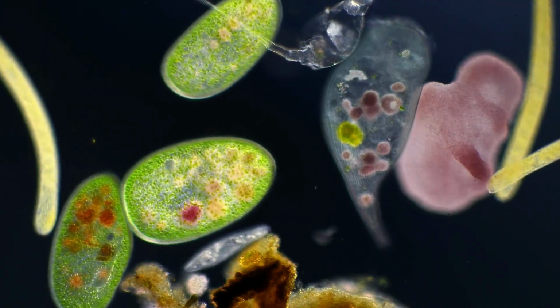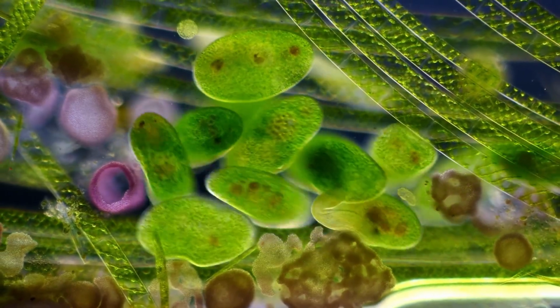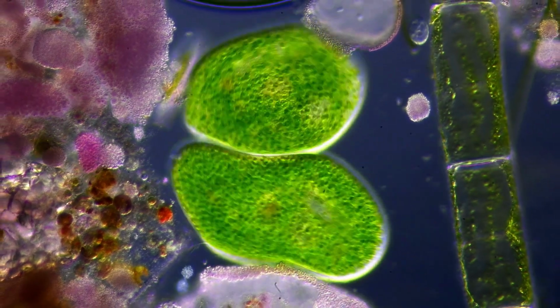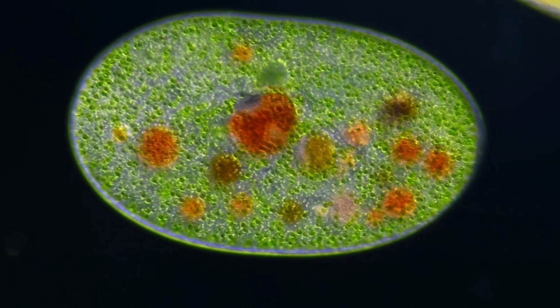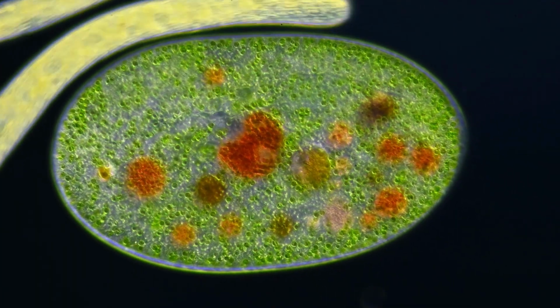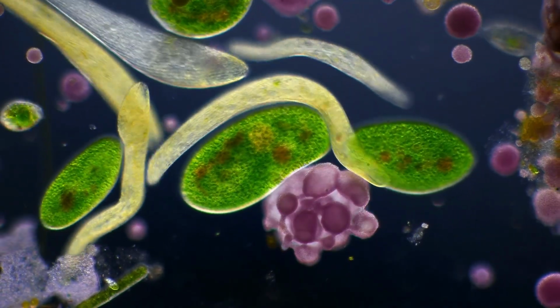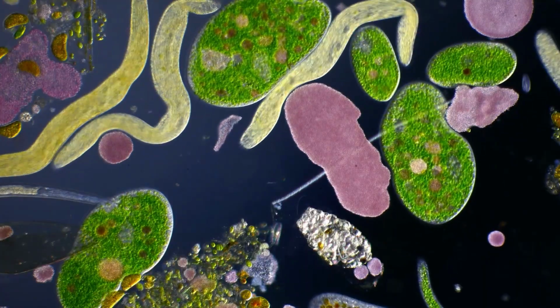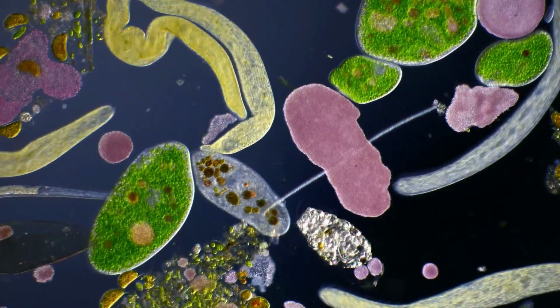In the sample I also found a lot of different green single-celled organisms, of different shapes and sizes. These two look like they are dancing. One thing they have in common is the presence of algae living inside the cells, giving them their green color. This benefits both the algae as well as the cells. The algae feed on waste products produced inside the organisms, and in return the algae produce oxygen for the cells and work a bit like internal oxygen factories. This symbiotic relationship allows the cells to live in oxygen-poor habitats.